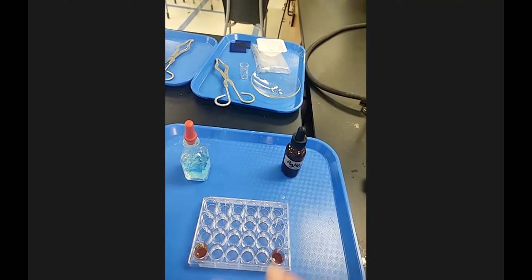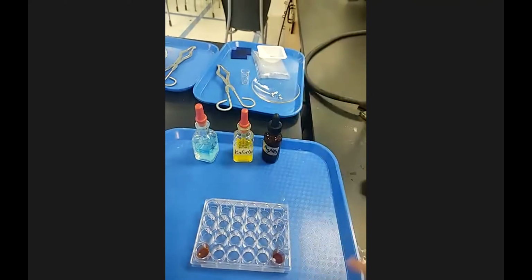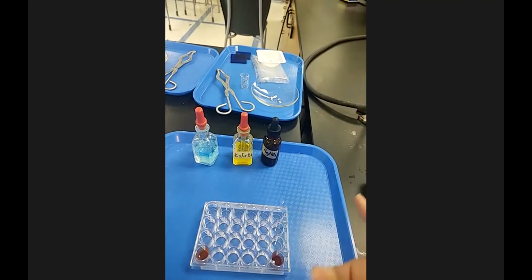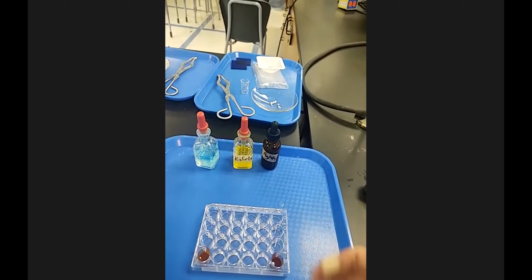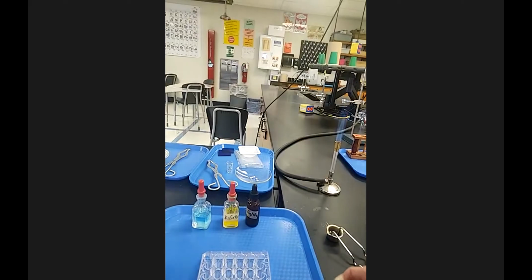There's not really, you have the before and you have the during, and then we'll let it sit for a little bit and see if it looks any different, but it's more of a later rather than an after. We're not testing for a gas or anything here. So come back to that one.